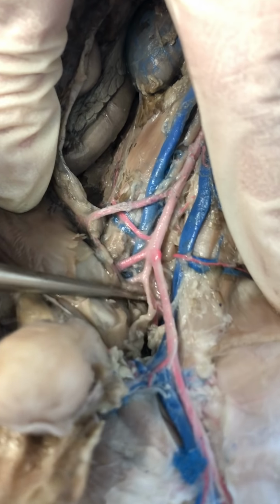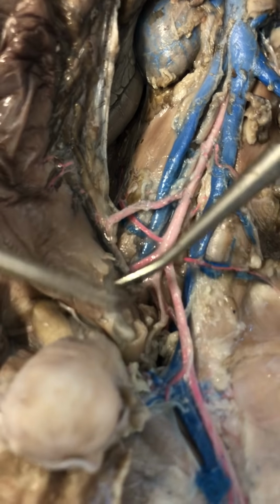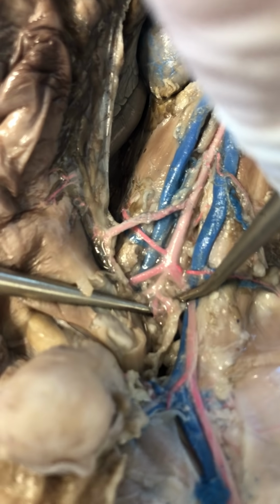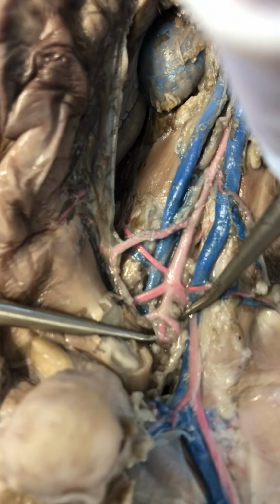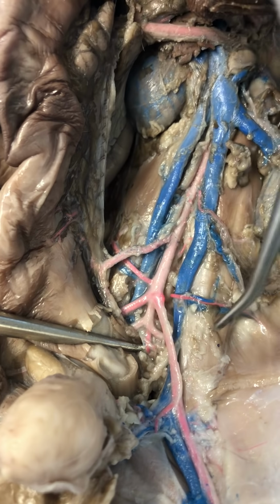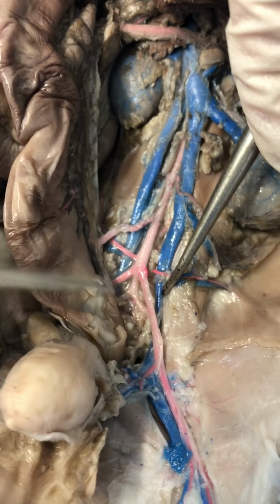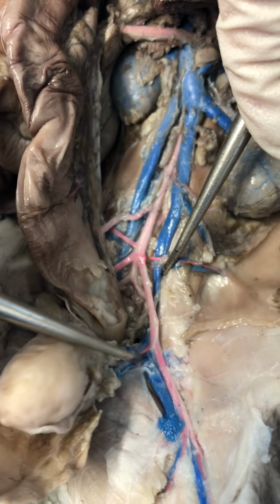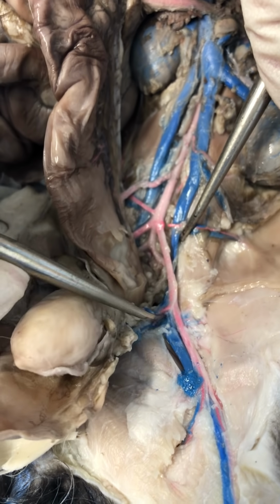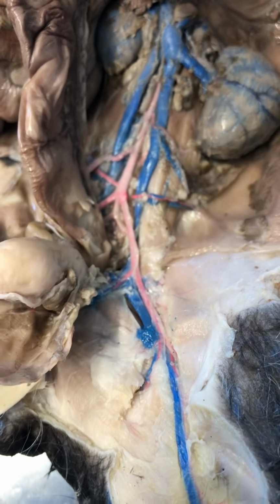So then sitting within the middle of my internal iliac, gotta really dig deep in there. Okay, see that? That is my sacral artery, sitting right in the middle of that internal iliac, okay? So then following my external iliac into the leg, it's external here. Right here is my deep femoral branch. So then after that, this vessel continuing in the leg is my femoral artery.